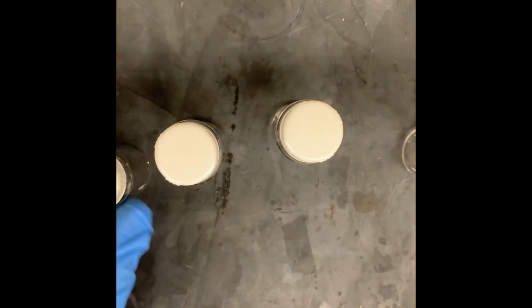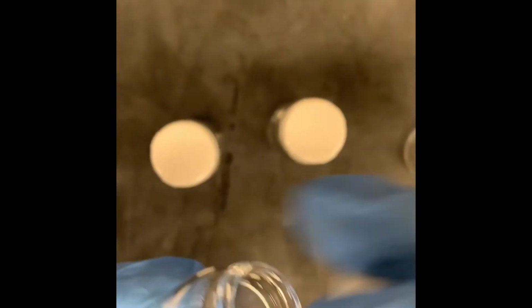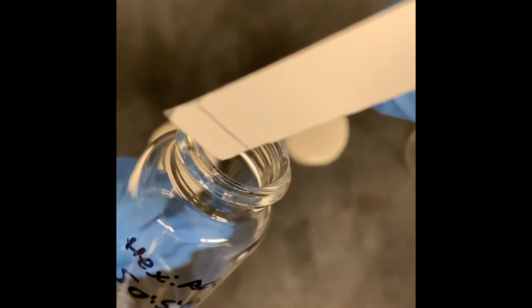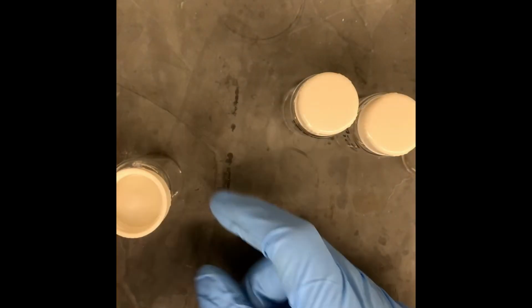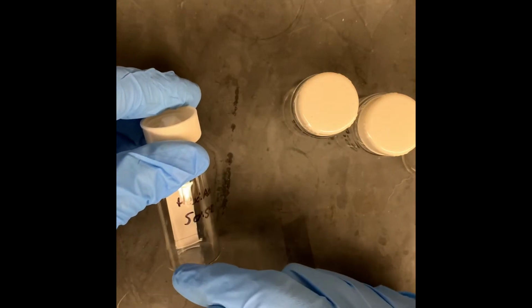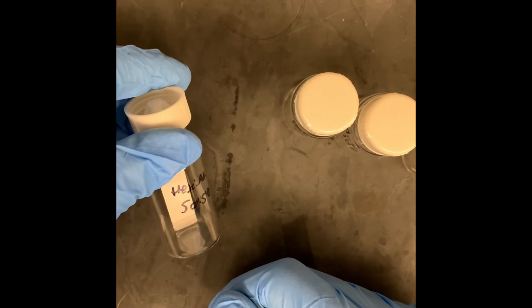And so very simply, if we want to place our TLC plate into the 50-50 hexanes acetone solvent chamber, we would unscrew it and very carefully place the TLC plate into it and very carefully put the cap back on. And so over time, the solvent level would actually run up the TLC plate, carrying the compounds that were in unknown solution number 3 with it to varying distances.